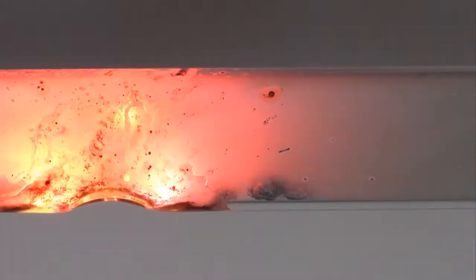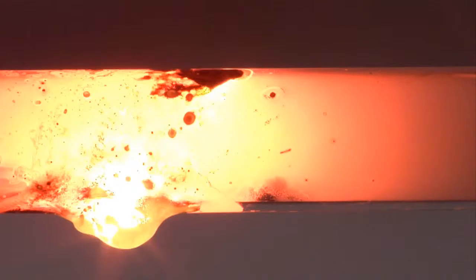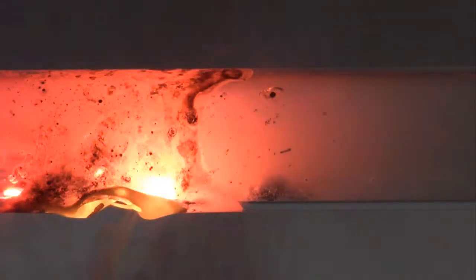This highly exothermic reaction produces enough energy for lithium to displace boron and silicon from the glass. The black material fused within the molten glass contains these elements.